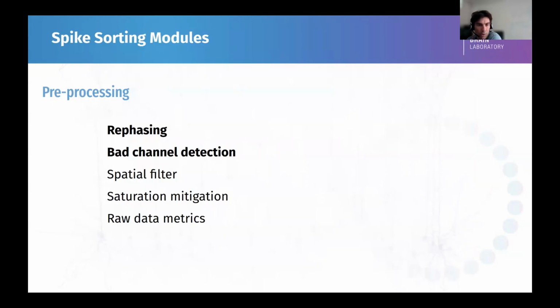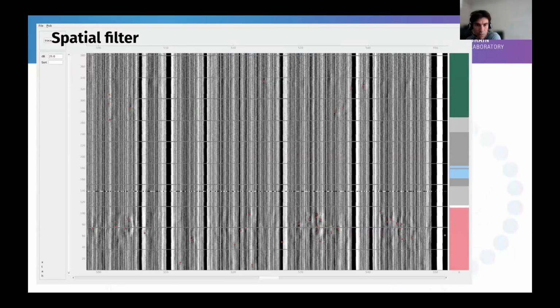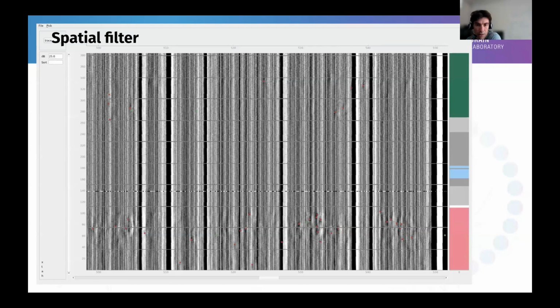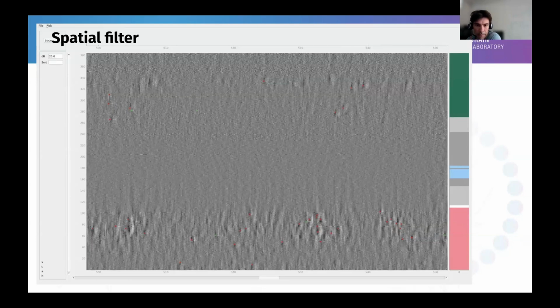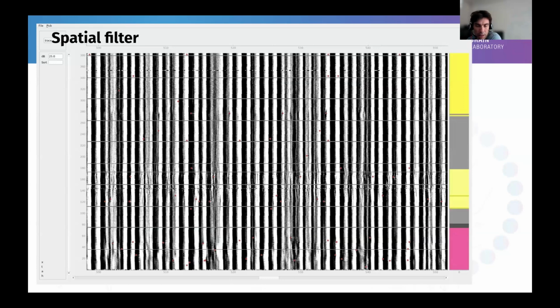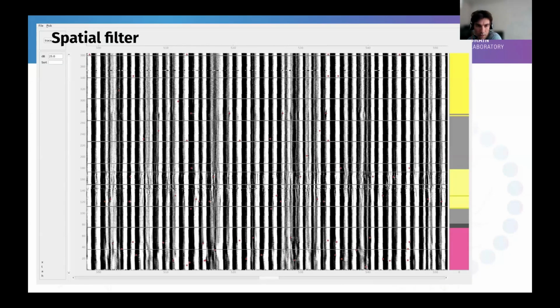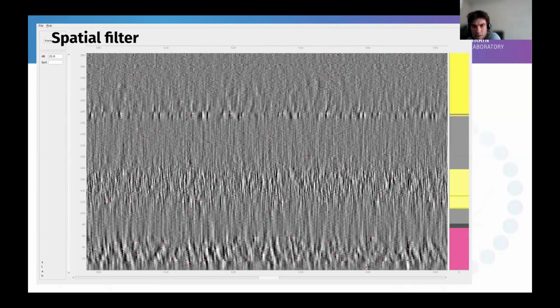The next step, I'm going to discuss a bit the spatial filter, the destriping. The spatial filter is common average referencing. I'm going to show examples that are quite drastic on the raw data, where you would think that there is nothing or it's unrecoverable. But if you align the channels and you detect the bad channels, you can do some kind of common average referencing and recover the signal underneath. This is before, and this is after the destriping. Before, after, this is the same data. Then another drastic example here where it's very high amplitude noise, and you can recover the signal that is behind the noise here. So those are success cases of this destriping.